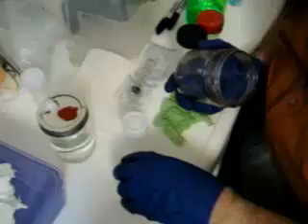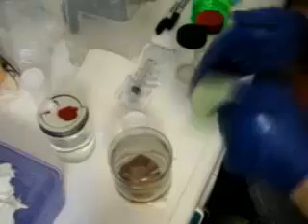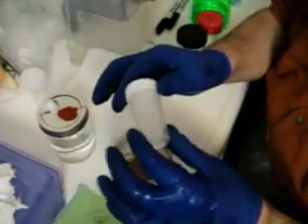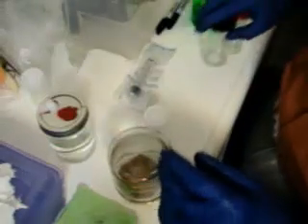I've got some shiitake mushroom caps that I have previously cut the stems off of. I cleaned them — I wiped them down on the cap side with hydrogen peroxide. And I've got a napkin soaked in rubbing alcohol, so you want to do all this in as sterile a process as possible. I've also got a little sample bottle, which I wiped down with rubbing alcohol to sterilize it.